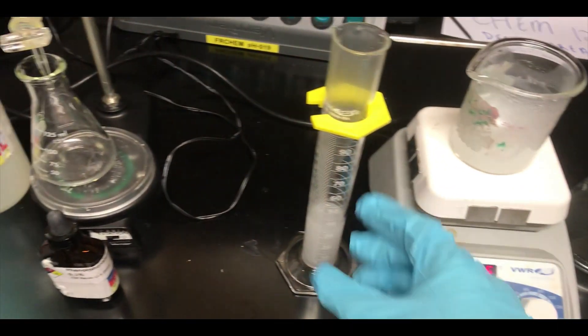The exact volume right here is not critical, as we're going to get accurate after the filtration. So about 35 milliliters or so there.